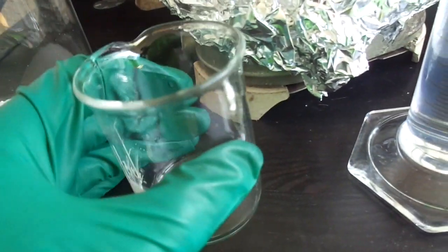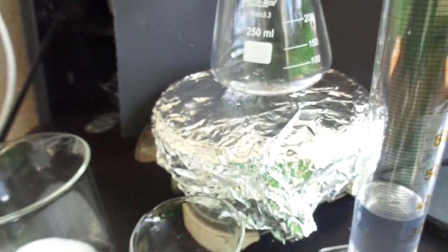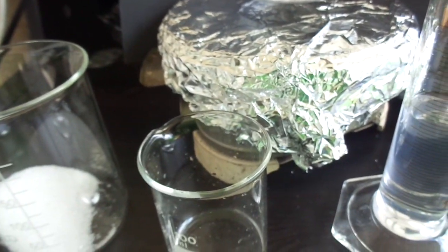And I also have a few ml of concentrated sulfuric acid. I'm going to put all of that in a flask and we're going to heat it up under reflux.